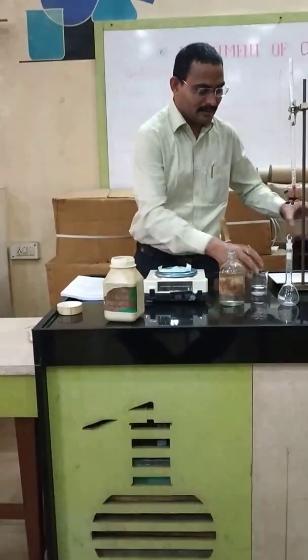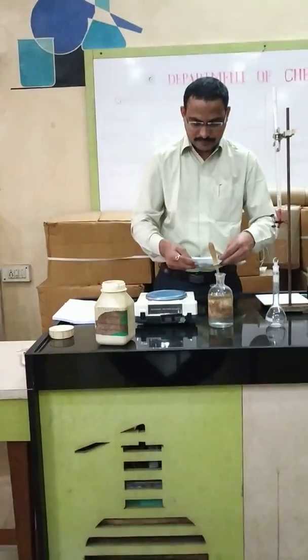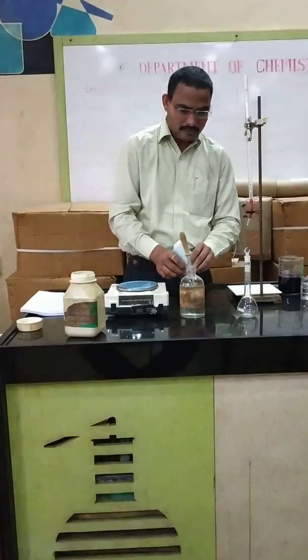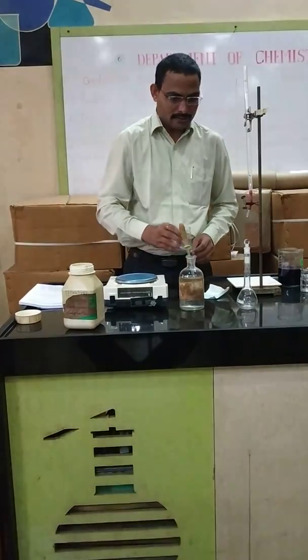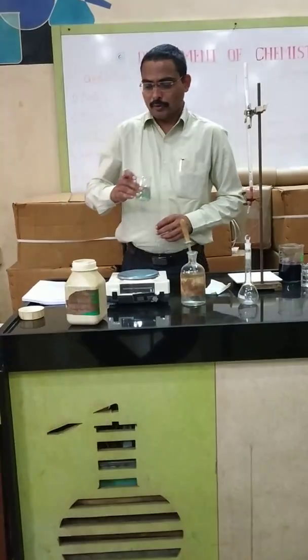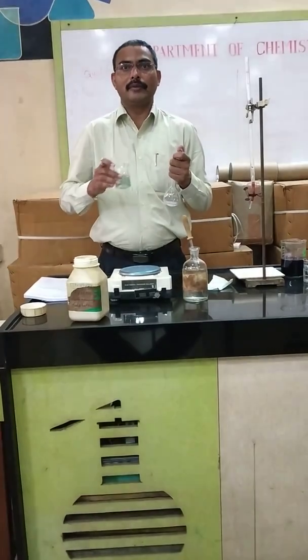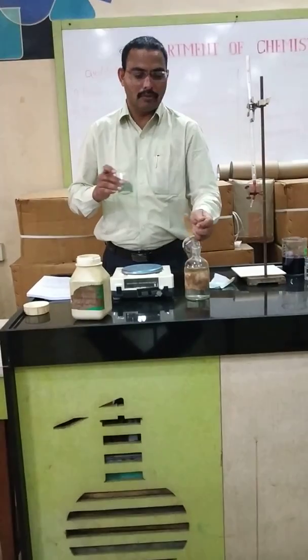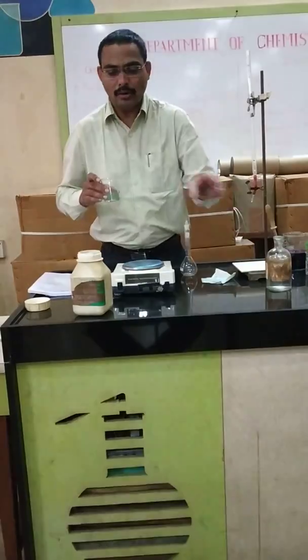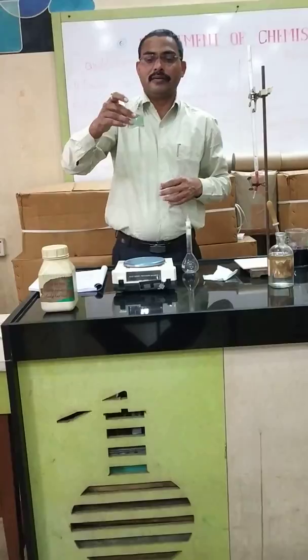Now we have to dissolve this sulfate into a beaker using a minimum quantity of water. With a glass rod we can dissolve this solution and prepare the standard solution of ferrous ammonium sulfate — that is 0.1 molarity. What is a standard solution? A solution whose molarity is accurately known is called a standard solution.